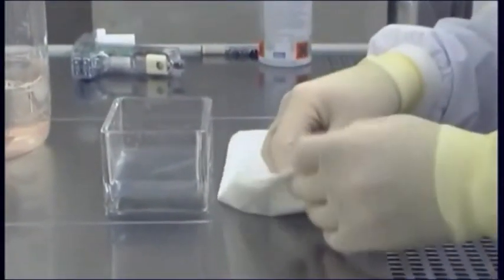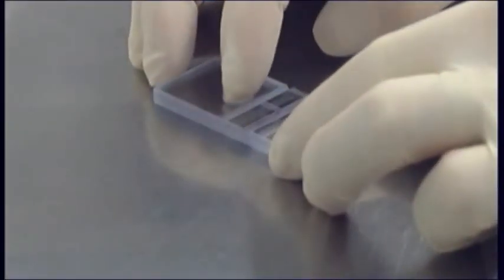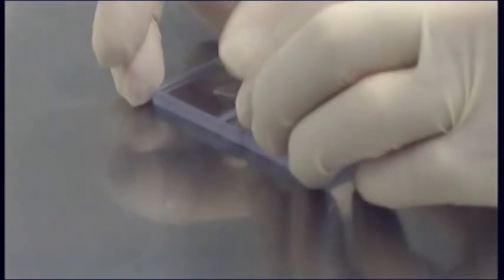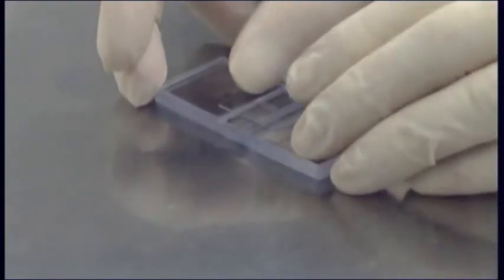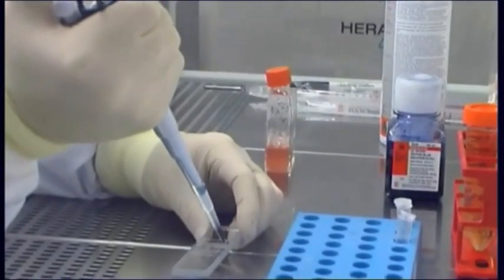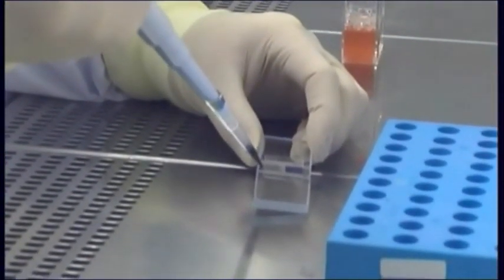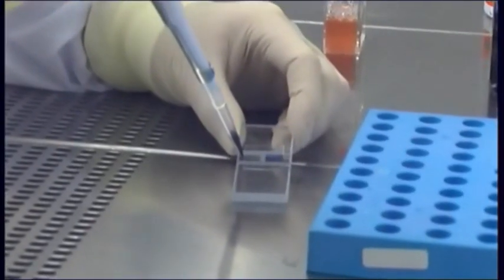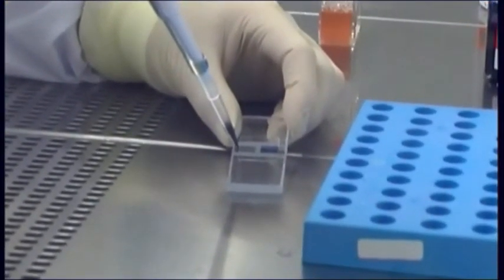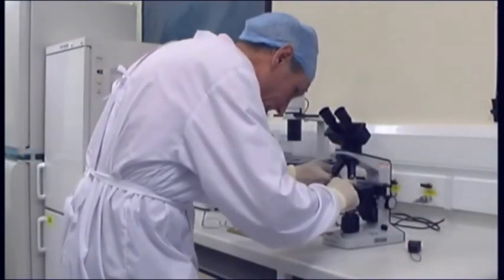Next, clean the hemocytometer, moisten the cover slip and slide it over the chamber back and forth using slight pressure until Newton's refraction rings are seen under the cover slip. Fill both sides of the chamber with cell suspension, allowing the chambers to fill by capillary action, and view under a light microscope using times 10 or 20 magnification.